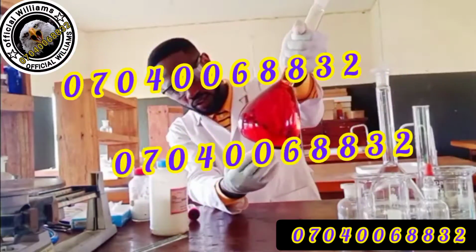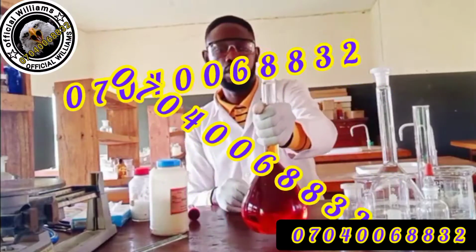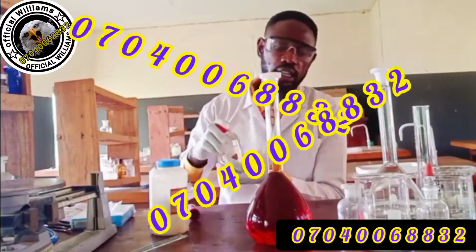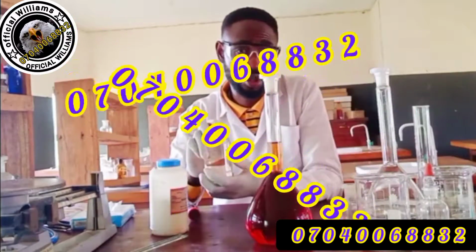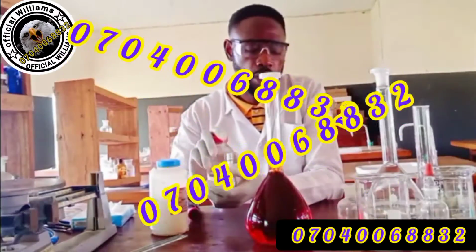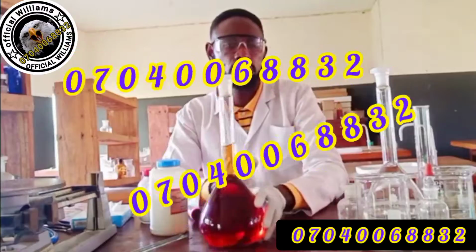You see, there are still crystals of undissolved iodine. They will still remain that way for a long time. But if I want the whole iodine crystal to dissolve, I will add more potassium iodide. And I say you shouldn't do that because the instruction says you should add 6 grams only. So just titrate any amount that dissolves in it. And there are many challenges facing this titration.